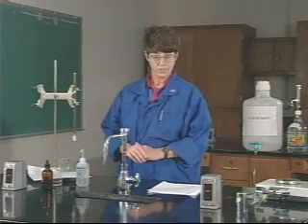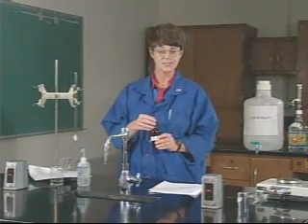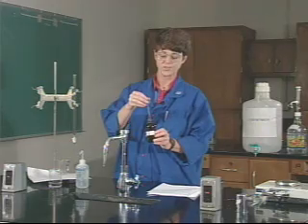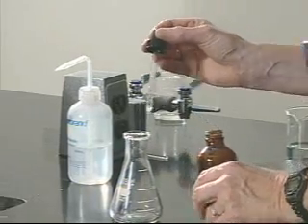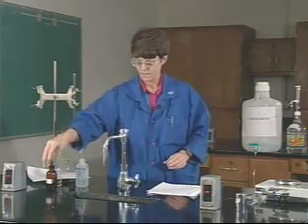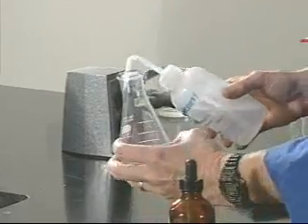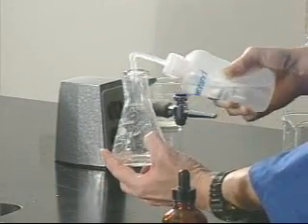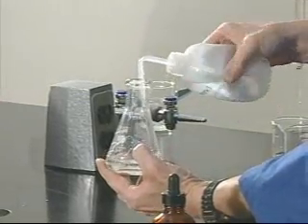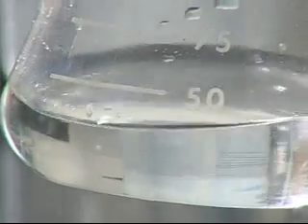After you've gotten your vinegar sample and weighed the flask, here is a step you want to be sure to do because it's easy to forget: the indicator for this experiment is called phenolphthalein, and you have to add it to your flask in order to get the color change. Add two to four drops of phenolphthalein indicator to your flask. Once you've added indicator, add about 30 milliliters of water to the flask, rinsing down the sides in case any vinegar splashed up. The amount of water you add at the start is not critical, but you do want some additional volume in the bottom of the flask.